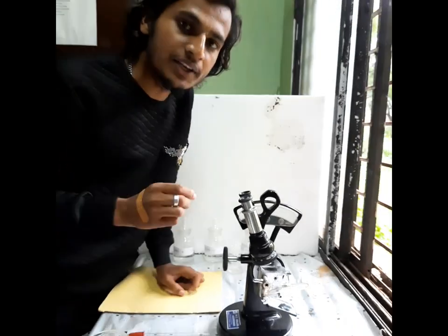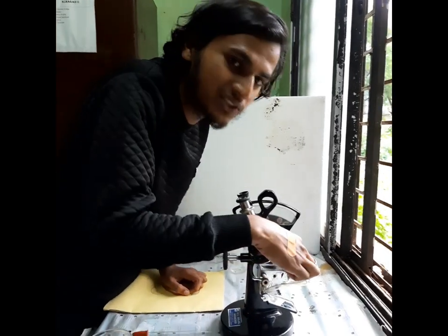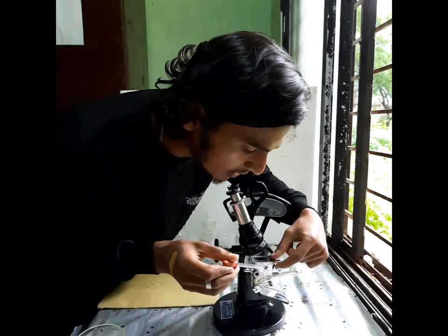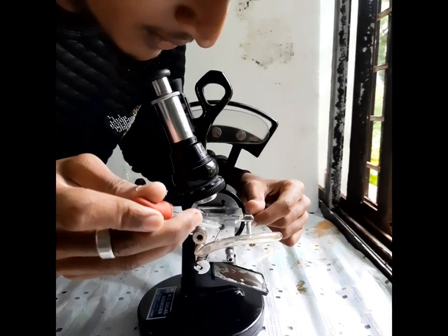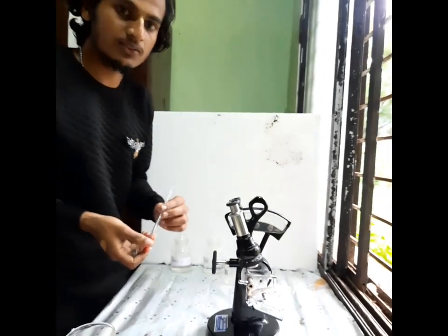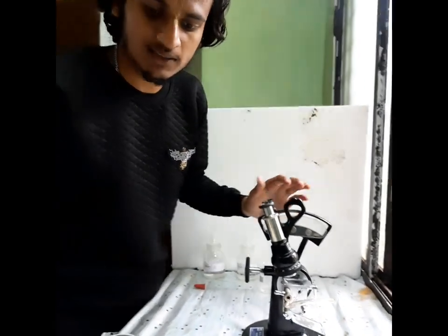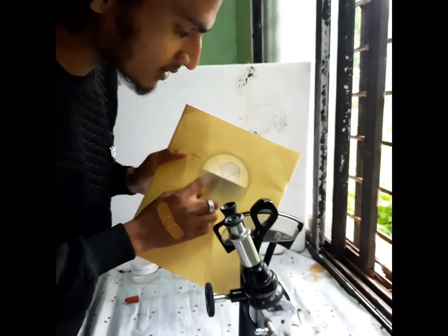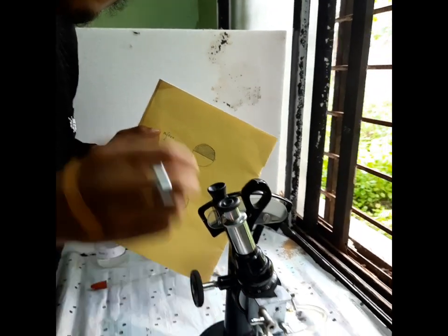Now we need to introduce the pure A solvent to the prism box by using a dropper. We have introduced the pure A solvent. After this, we have to adjust in such a manner that we get the half moon structure. We should get this half moon structure by doing this adjustment after introduction of the solvent.